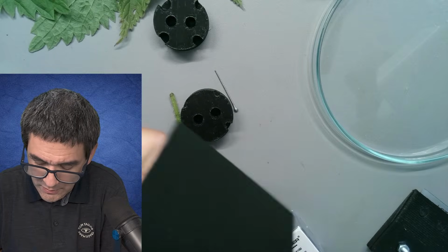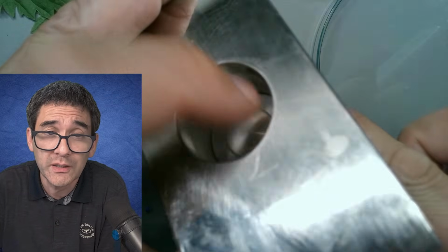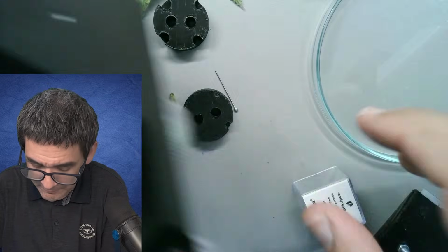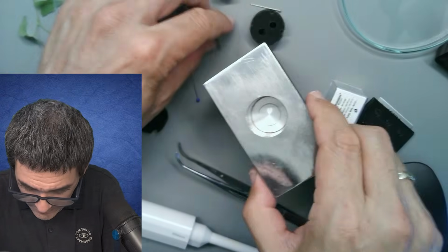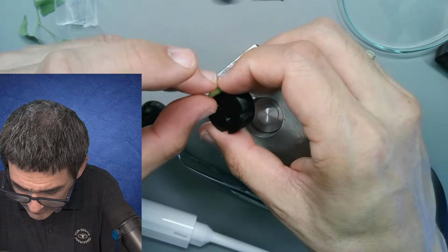I'm going to turn it. I'm not going to clamp it to my table. Okay, I have to turn this, I have to lower the piston here. By turning it, I'm lowering this piston. Okay. So, let's make it a little smaller, brighter. So, this one goes in here.